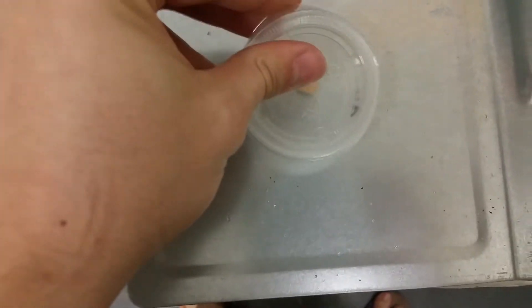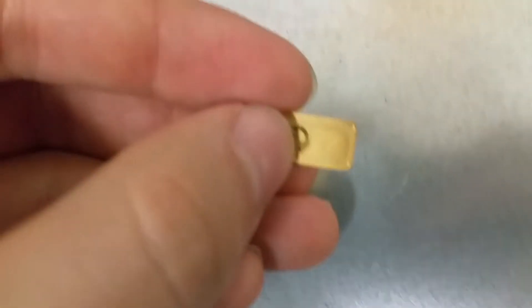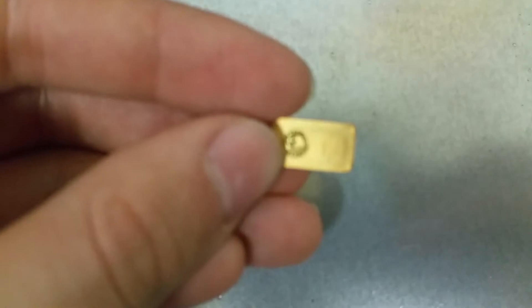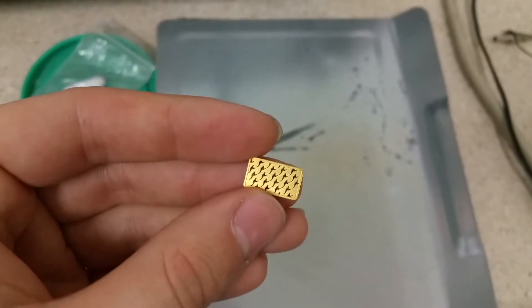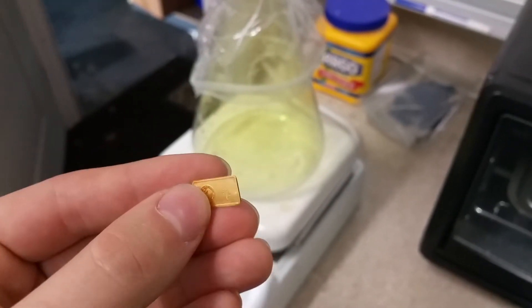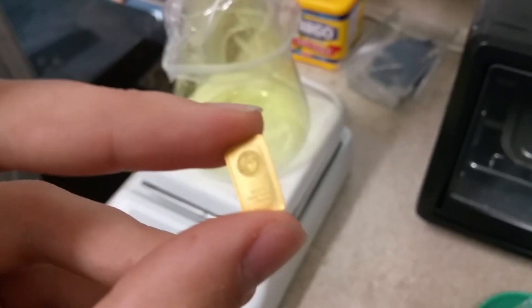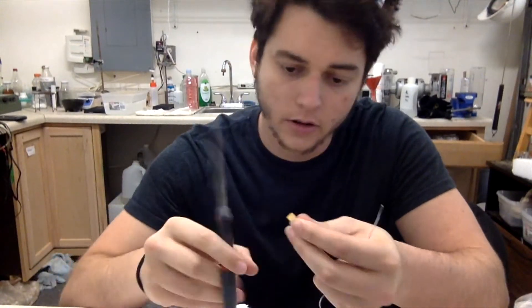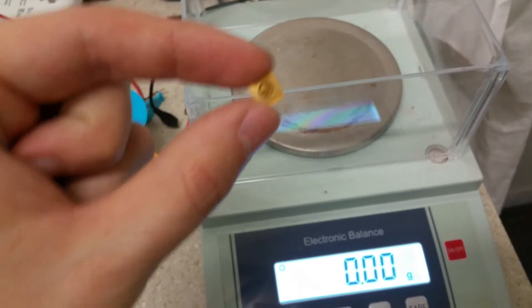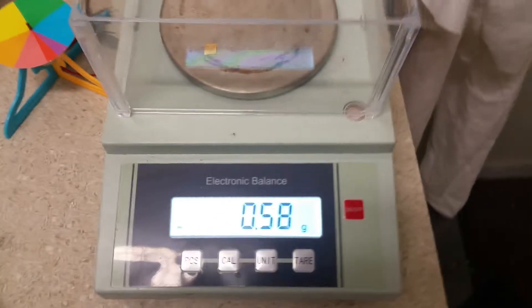And now the gold. This little nugget is one gram of pure gold that I bought online for this very purpose about three years ago and I haven't got around to it until now. I'm going to split this little guy in half and use about a half gram of gold and try to react it with that chlorine gas to make gold chloride. I've read that it requires a good deal of heat, so I'm actually going to heat up this little gold bar and hang it in there with a copper wire. It looks like I'm almost right on the money — no pun intended — 0.58 grams.